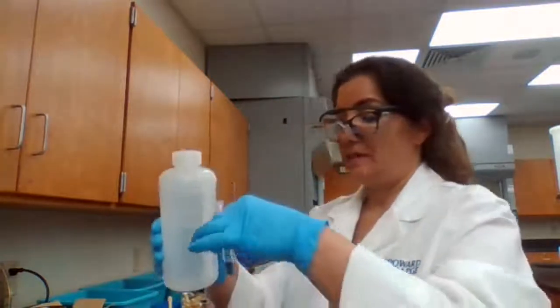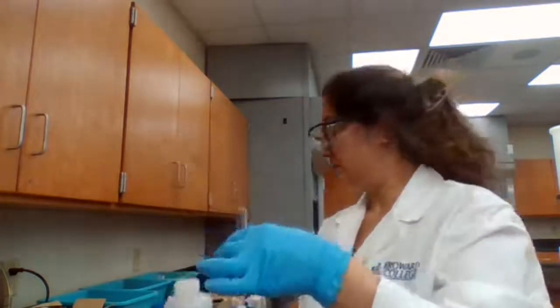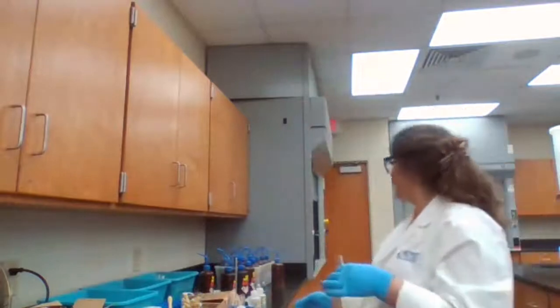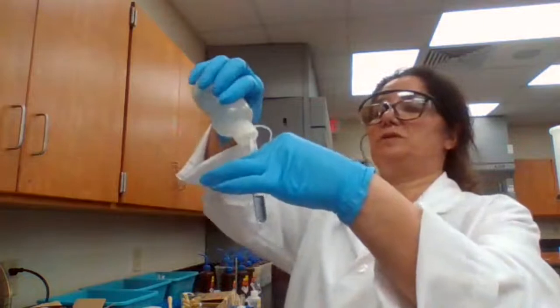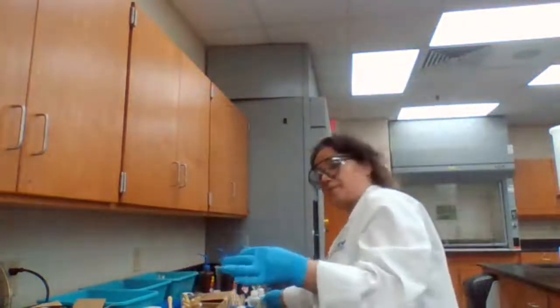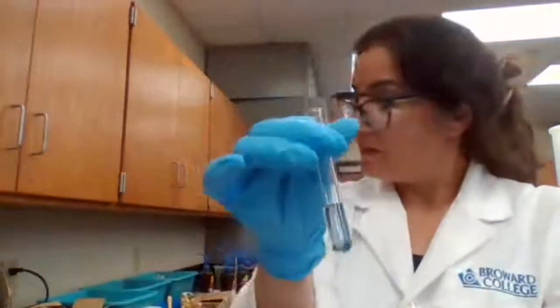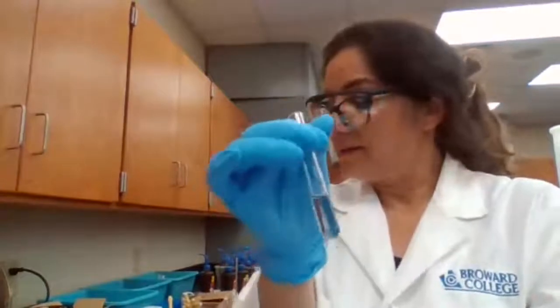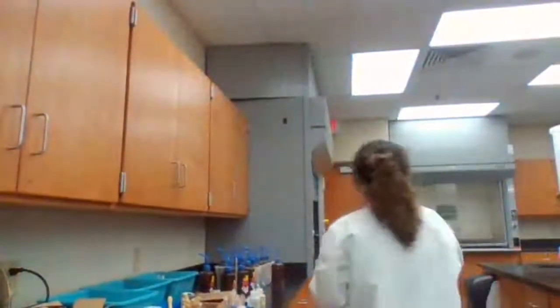Going to add a couple drops of water following the procedure. 10 drops of water. 2 drops of HNO3, to make sure the solution is acidic. Okay. This is before adding the actual reagent. And then we add a small portion of sodium bismuthate, NaBiO3.